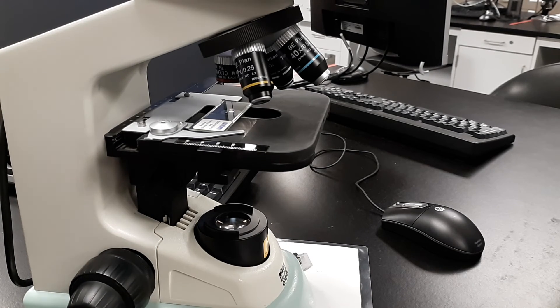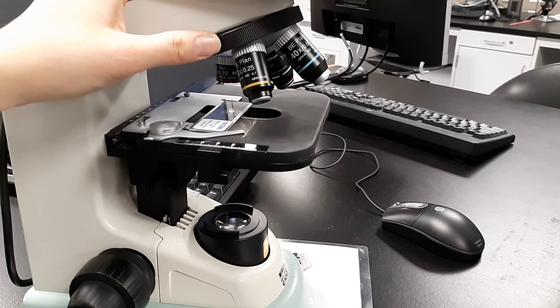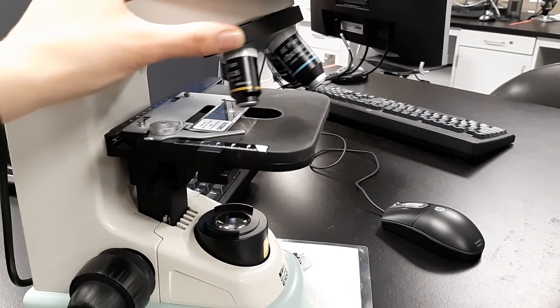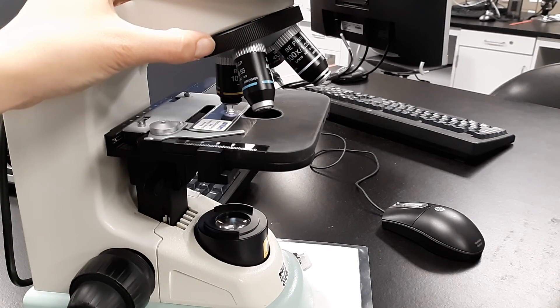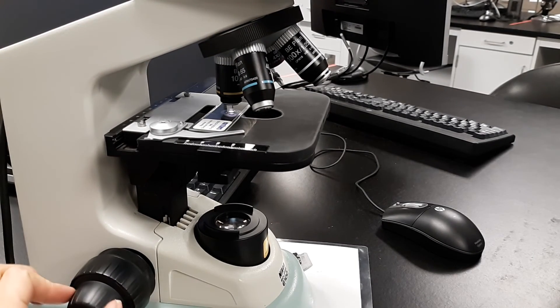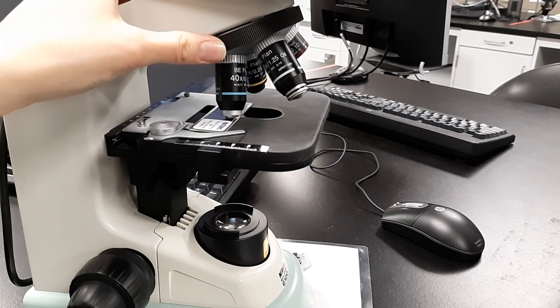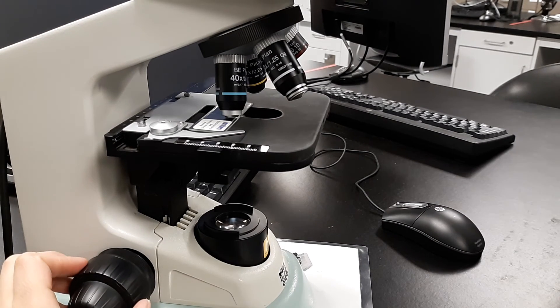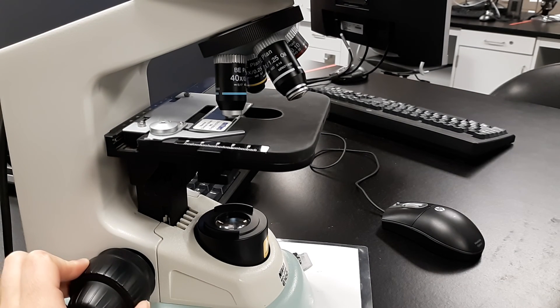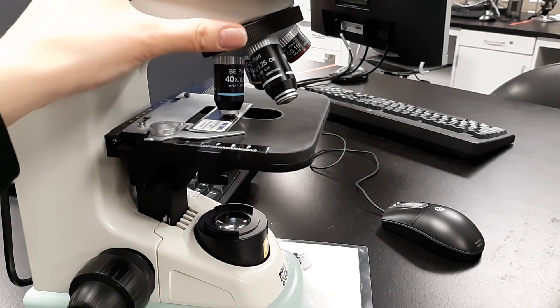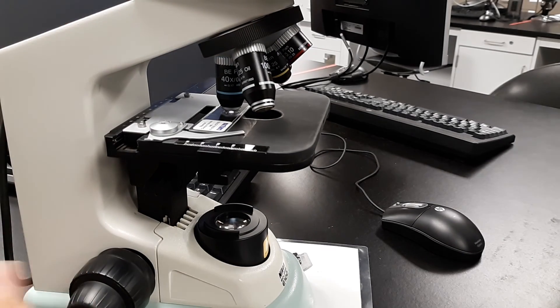The one rule of thumb is you always start on red. This is like level one of Mario—start on red, get it nice and crisp, then fully rotate. From here, you'll barely need to fine focus. Blue is super sensitive. I always rotate halfway in, go down about a millimeter, rotate in, then fine focus away from myself slowly until the item appears.